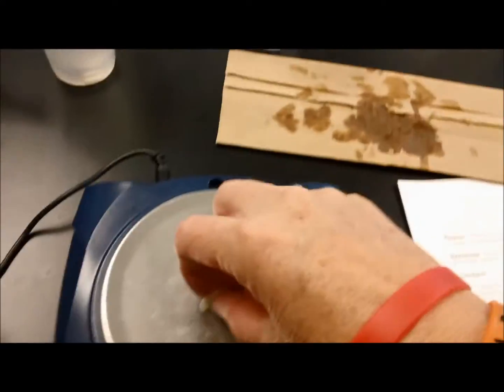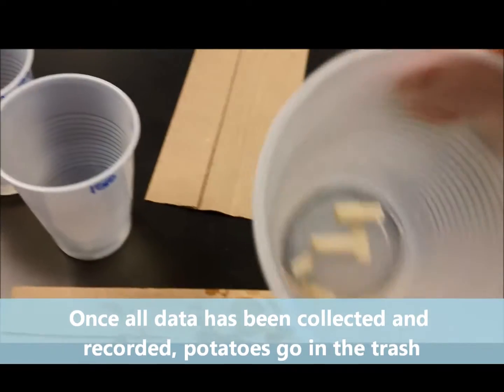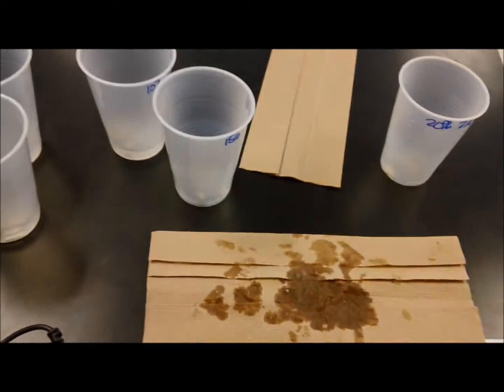When we are all done, the potatoes will go in the trash, and we will rinse out the cups and dry them out so that another class can use them.